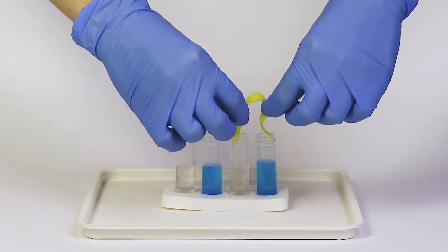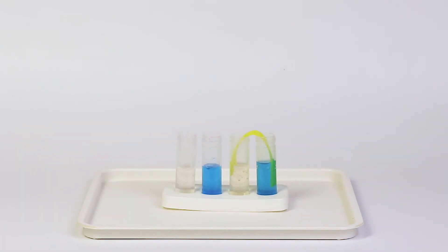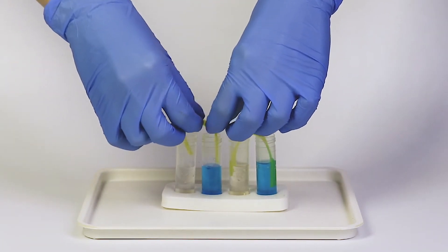Into each pair of vials, insert a piece of absorbing fabric so that its ends are immersed in both solutions.